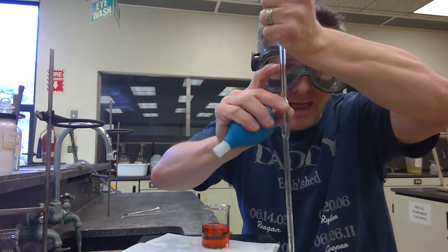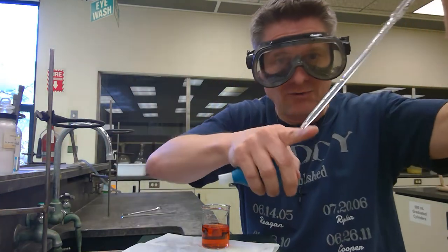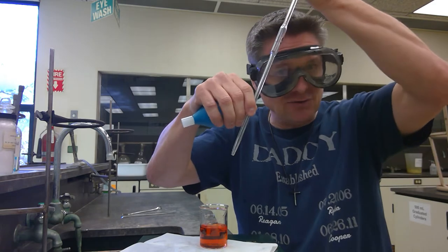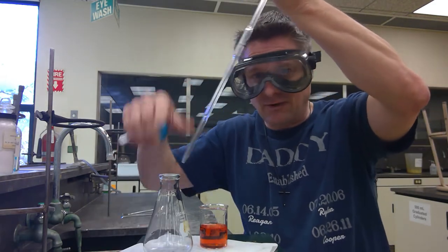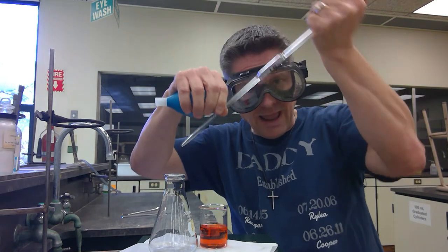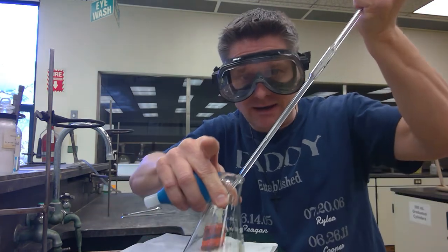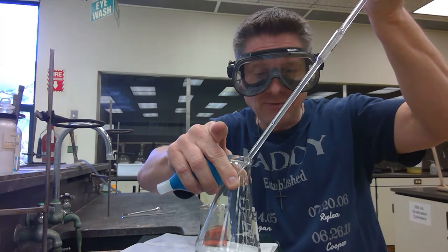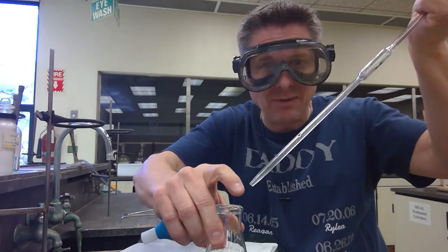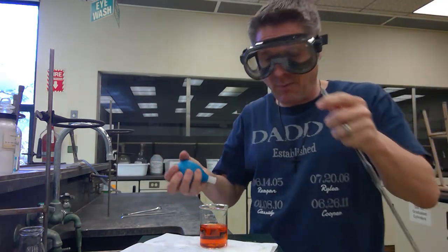When you get that meniscus bottom right on that line, seal it. If there's any drops on the end, tap those off — you don't want a drop hanging off the end because then you have more volume than you need. Bring it over to the container you're transferring it to, pop it in there, let go, and drain it in. When you're draining it, get it down in there so you don't lose any. Hold it at an angle so you don't splash. Let it drain into the container. Make sure your containers are ready to go. It's always good to practice a little bit.